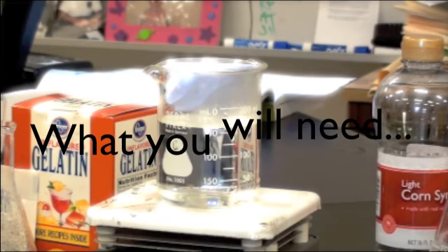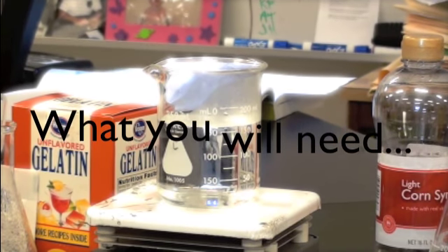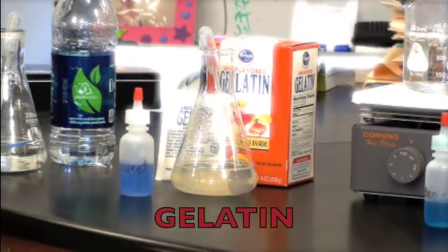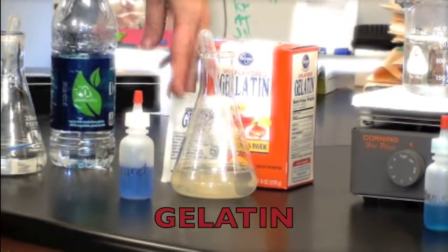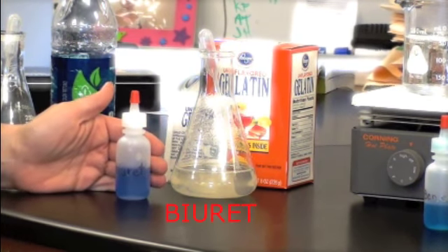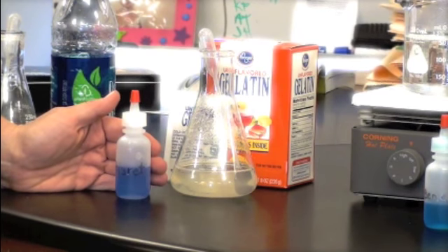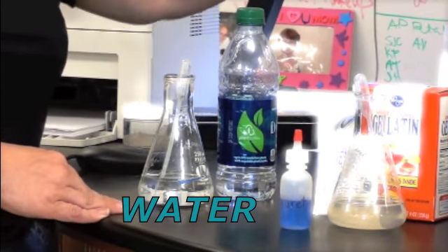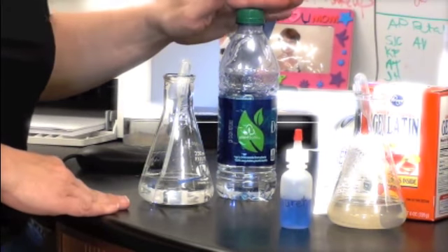We're going over the materials list before we get started. Let's begin. Gelatin. Powdered, this is our source of protein. We've diluted it in warm water, and a reagent, Biuret, to test for its presence. Reagents, we need water. Water is to dilute our other samples in and to serve as our negative control.